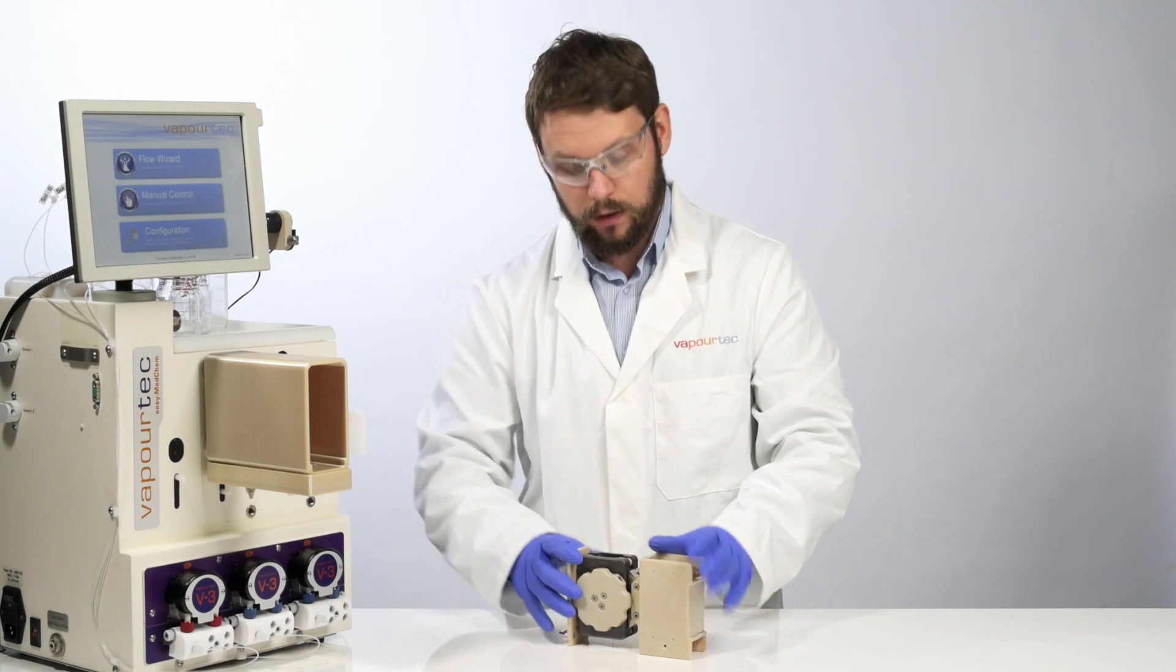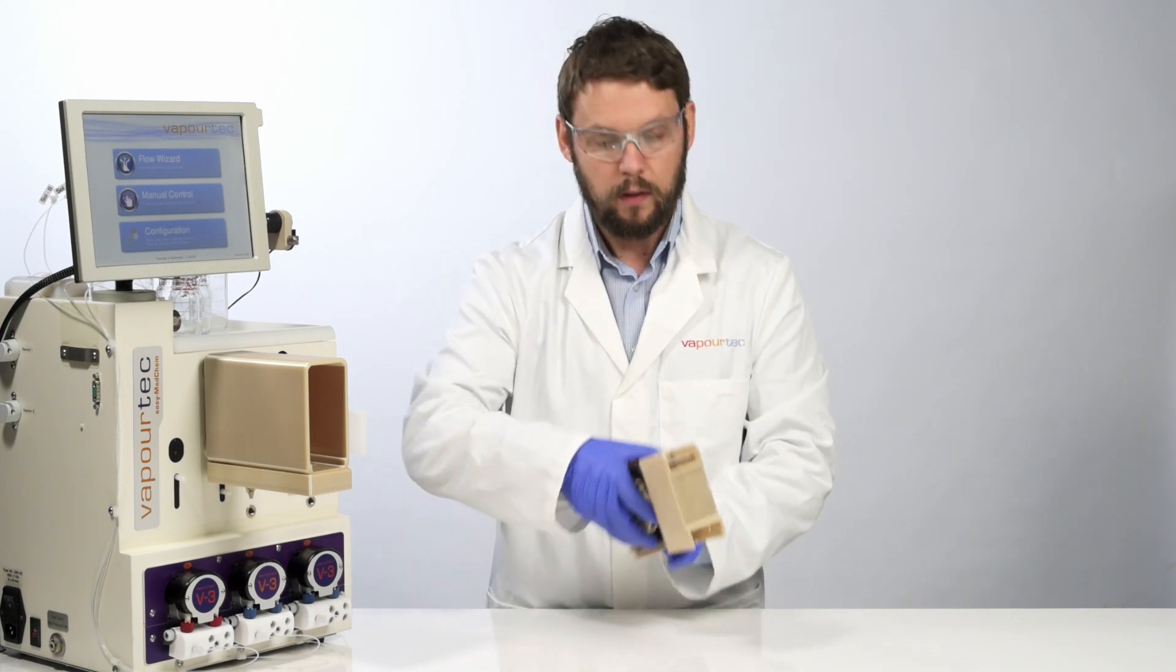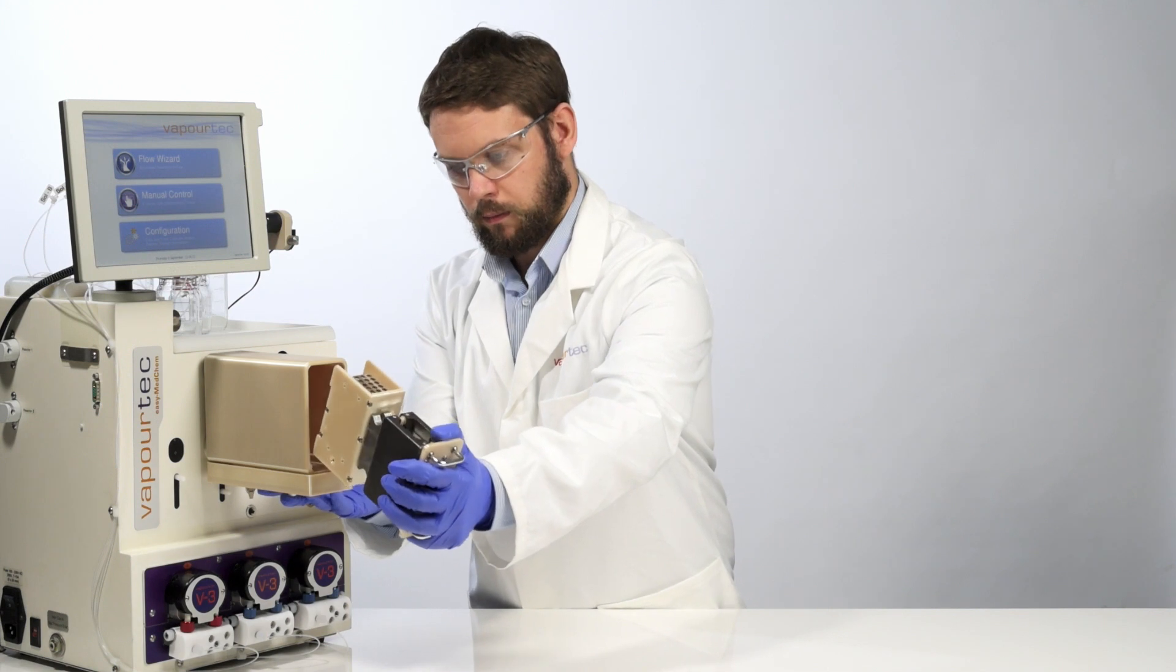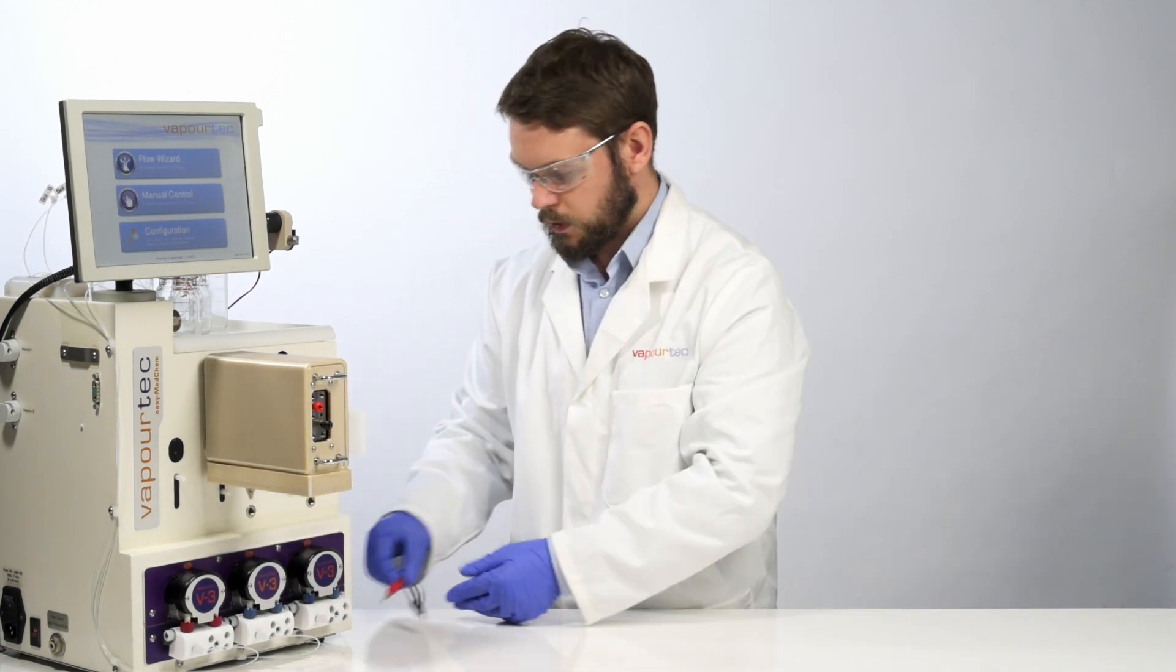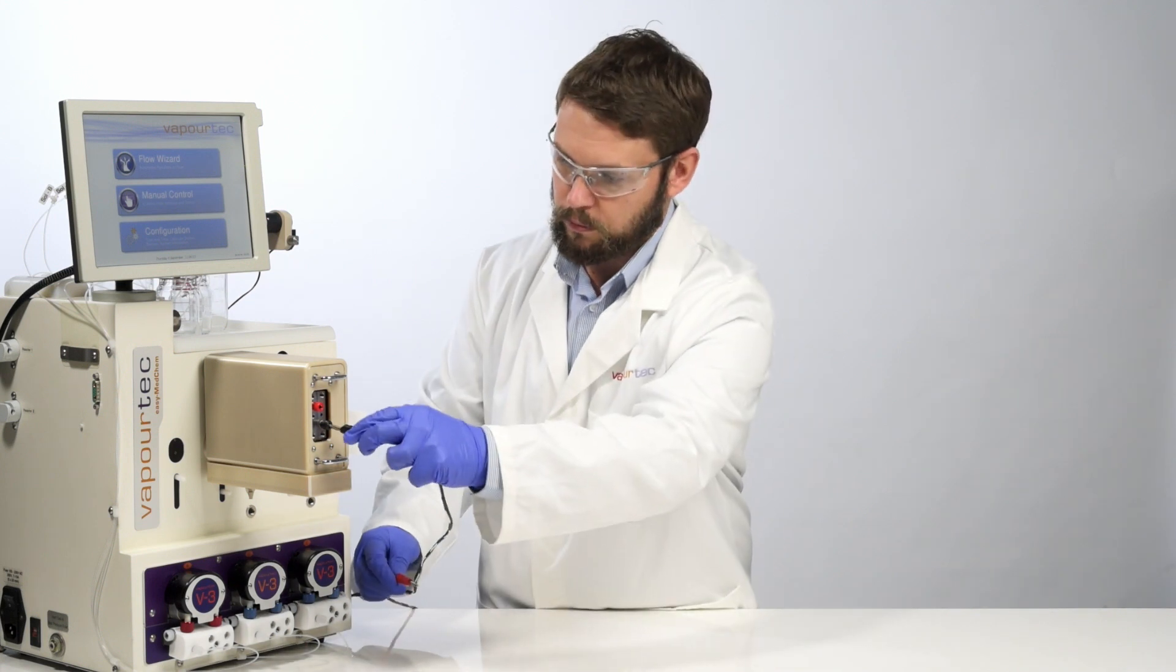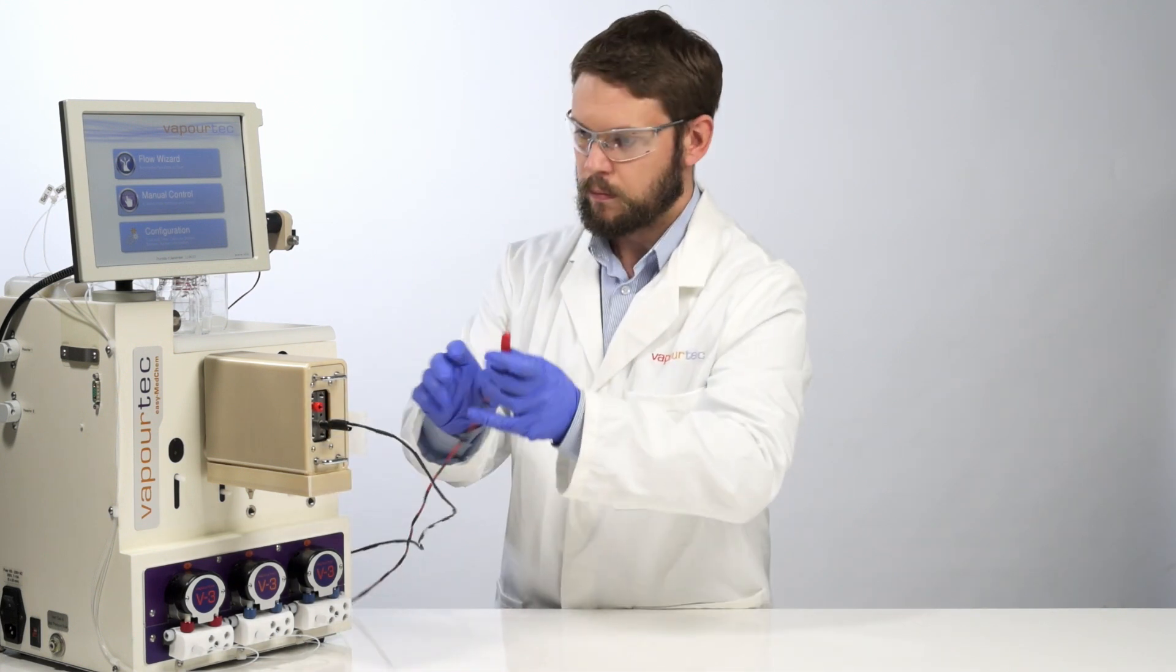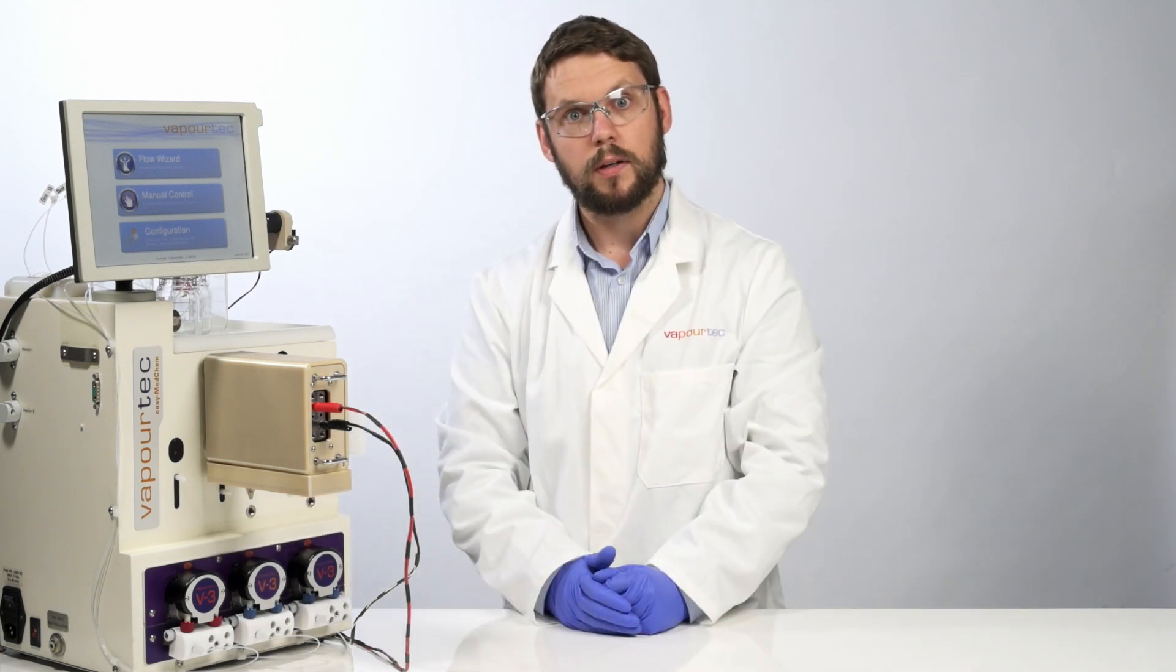When you've reassembled the reactor and you've clamped it tight, the whole assembly slides back into the housing. Then you attach your power cables and you're ready to run.